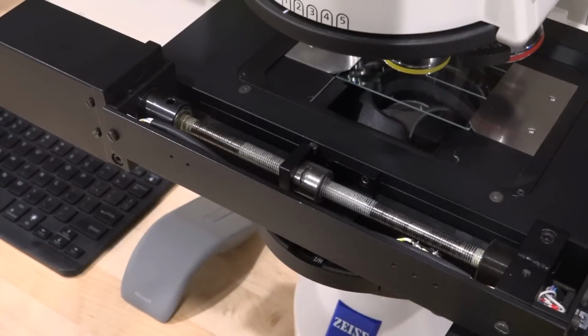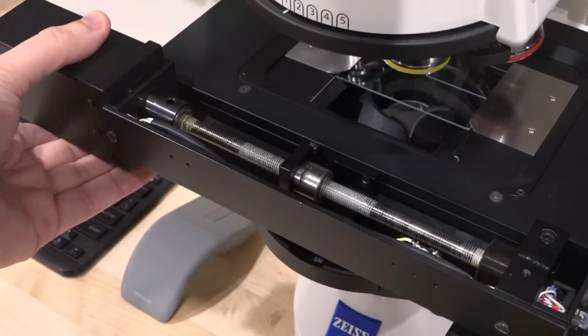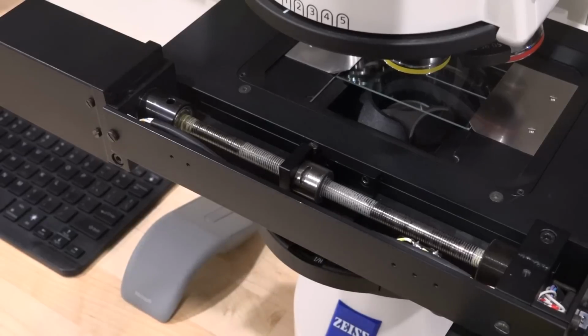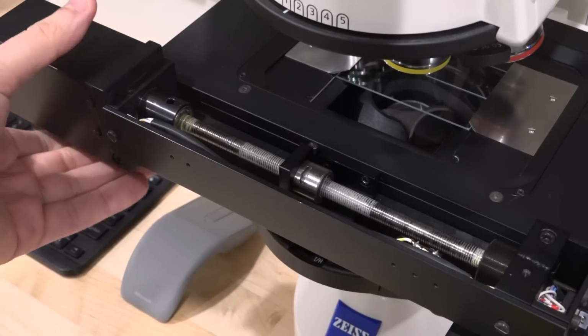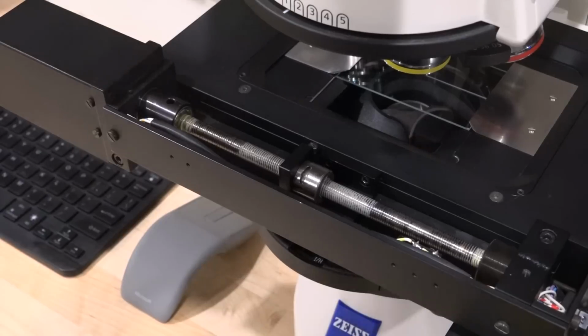So here's the structure of the X movement, which is the same as the Y movement. This is just easier to show you this one. There's a DC motor in here and an encoder in the back of it, and a PID controller wrapped around the entire structure inside the controller. That PID controller is always monitoring the precise position of the DC motor using the encoder. So when this thing is energized, I actually can't turn this, because if you turn it, it will resist that movement. There's a PID controller around it, and it will constantly correct it. As a result, the instrument always knows the exact location, no matter what the mechanical pressure is on the system. And this is pretty important for something that needs to move submicron distances, of course.